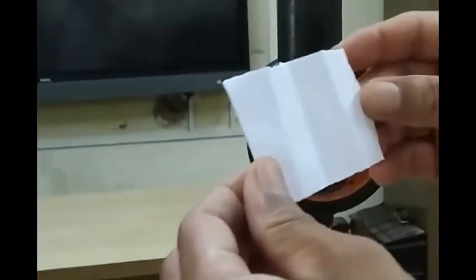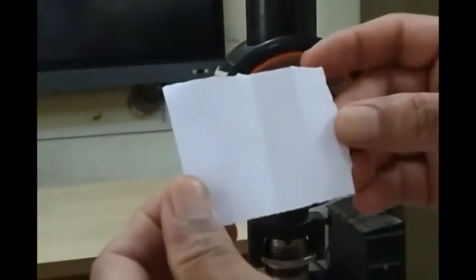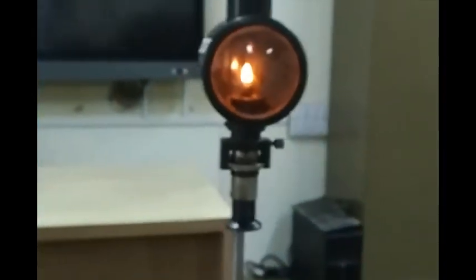Now we find the paper chit is almost clear — there is no smoke or soot produced. So this height can be taken as the smoke point of this fuel. Reading it properly, it comes to around 22 mm — slightly greater than 20 mm, confirmed as 22 mm. This is a 22 mm flame height. This reading also has to be taken with parallax error removal, which gives us around 22 mm as the smoke point of this fuel.